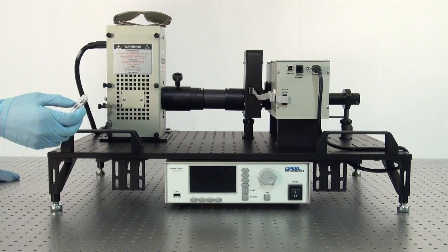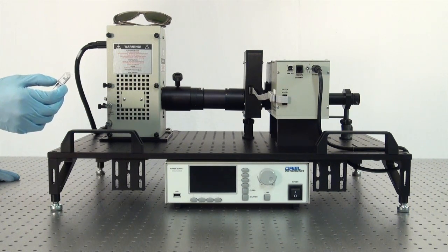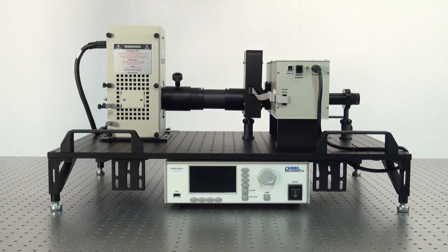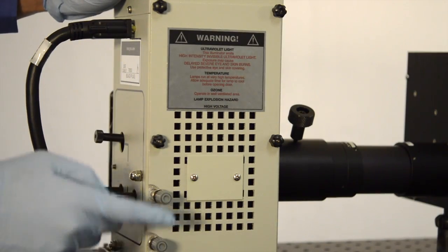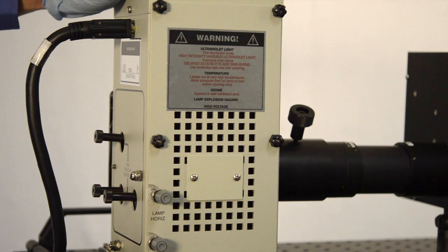This is the replacement lamp, the 250 watt quartz lamp. I'm going to start by unscrewing these six thumb screws on the side compartment of the lamp housing to access the lamp.